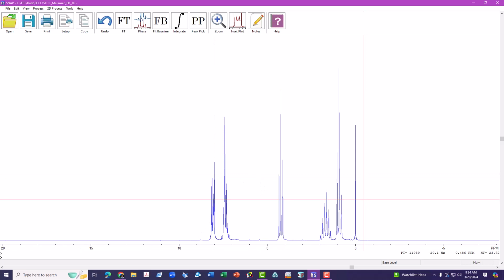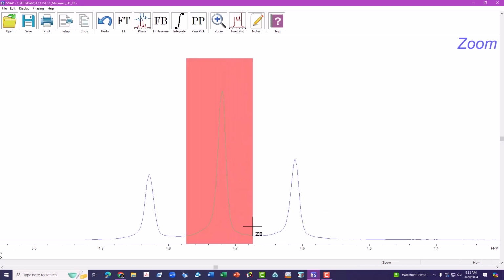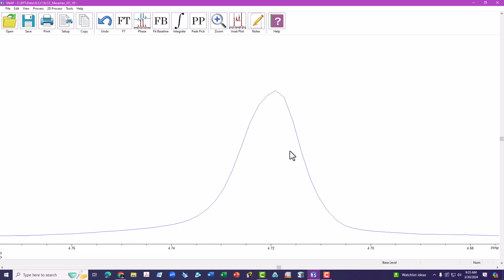And we'll kind of mess this up again. So another way, and this way is actually a little more useful if you're using things other than TMS. Sometimes you use chloroform or you use a solvent peak for it. So let's say that we know the chemical shift of this tall resonance in the middle here. I'm going to zoom in on a resonance that I want to set.